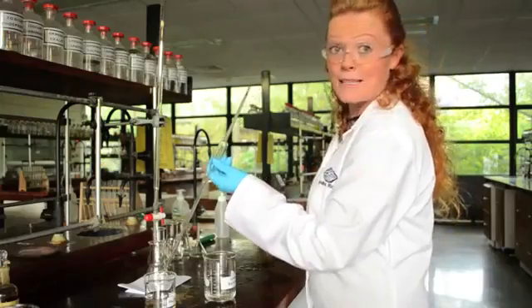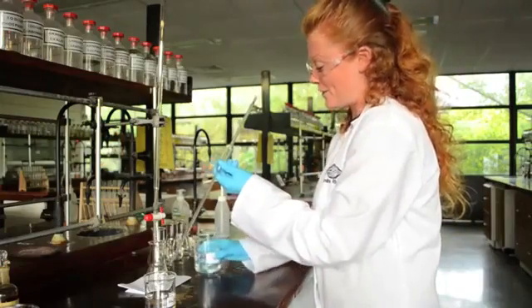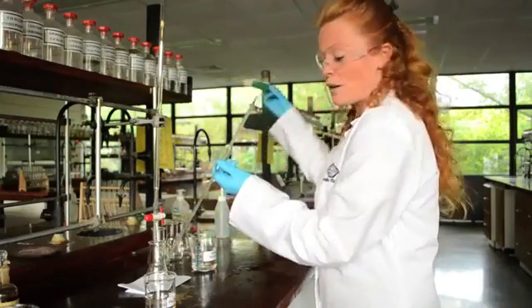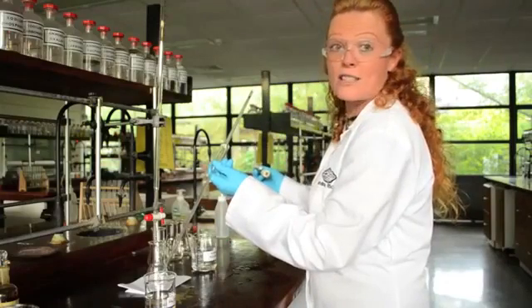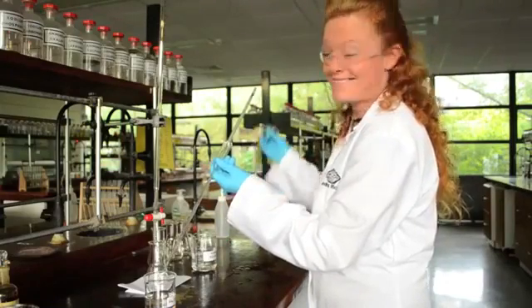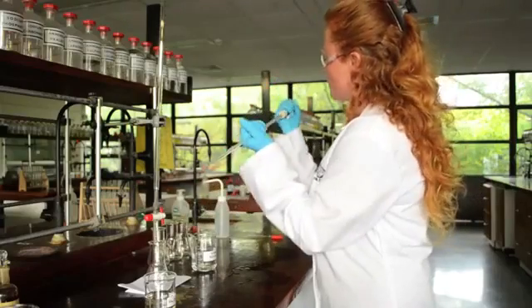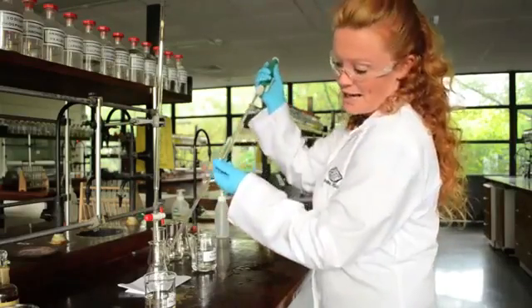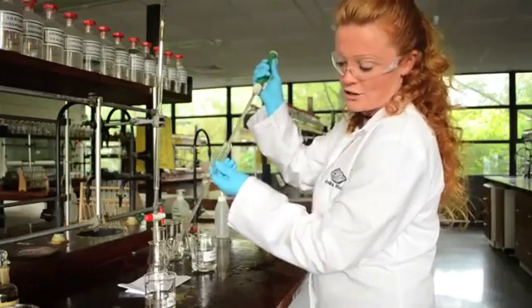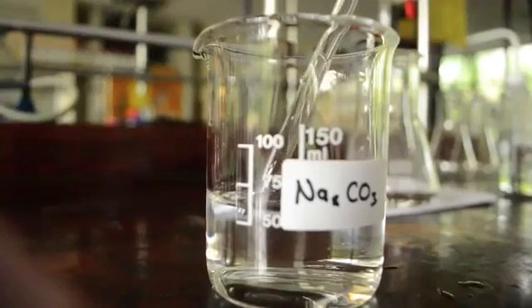I'm going to fill my pipette using a pipette filler. We're not going to do it like they did in the old days, sucking up through the pipette. So, I attach my pipette filler onto the pipette, and I take my sodium carbonate solution from the clean beaker that I just filled.